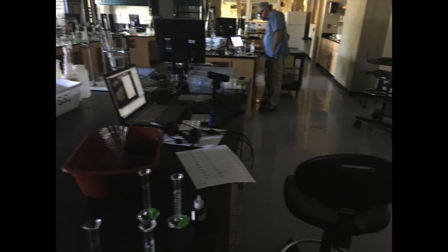So the second round of tests, I had a couple of the reagents and he had the rest of the reagents, so I was measuring half and he was measuring half, basically. That also had its own problems, but it went a lot faster, and so we were able to keep up a fairly steady stream of things to show the students.